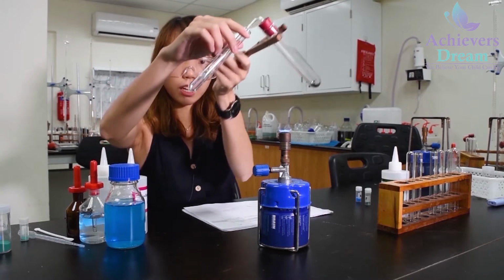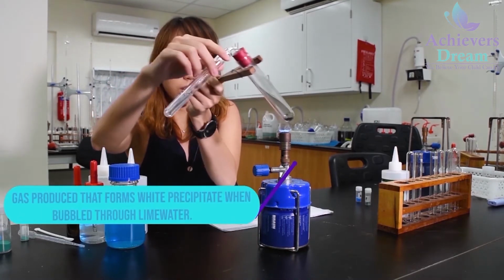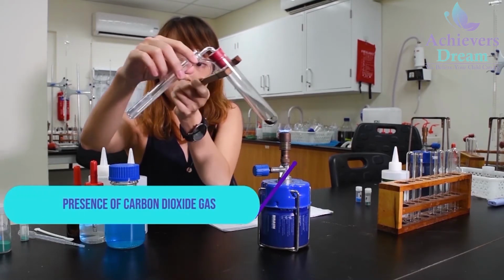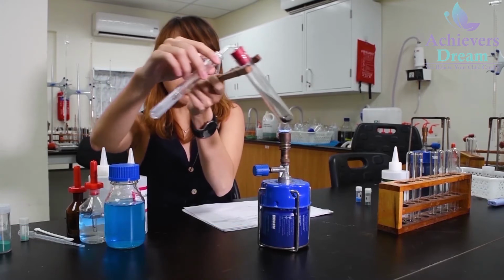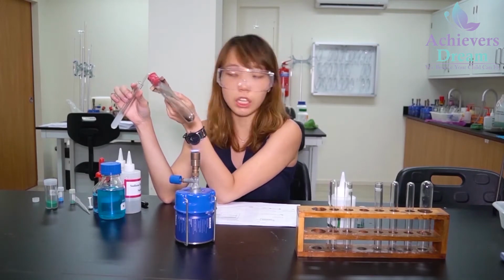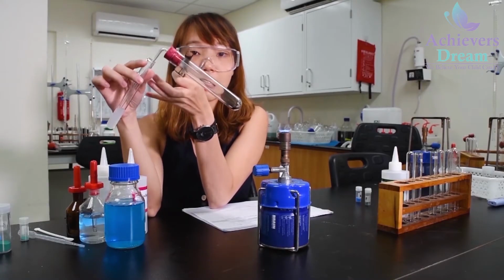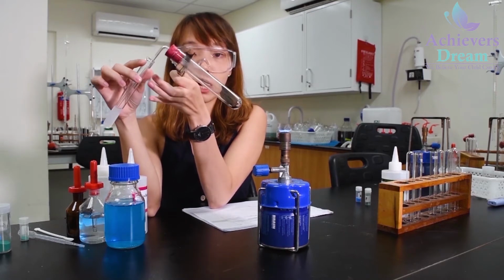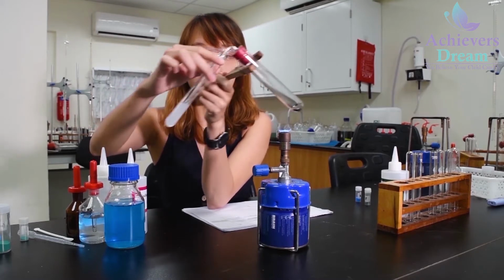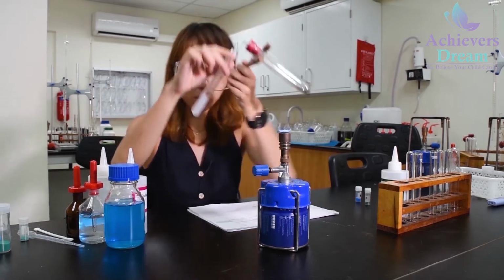So you realize that there is some white precipitate produced in your lime water. This indicates presence of carbon dioxide. Why did I use the lime water test? Because when you see your solid salt P, it's green in color. So based on your qualitative analysis knowledge, you should be able to guess that this solid P is copper carbonate. When you heat it, you should expect carbon dioxide to be produced. So I'm doing the lime water test, and there's white precipitate produced.